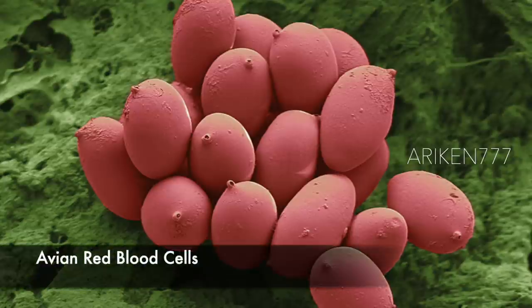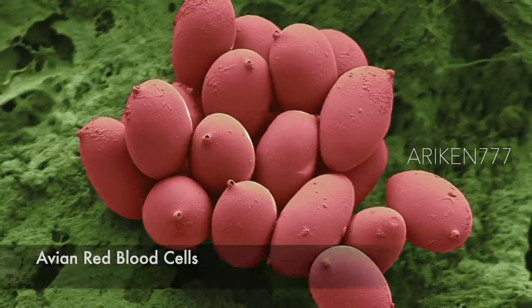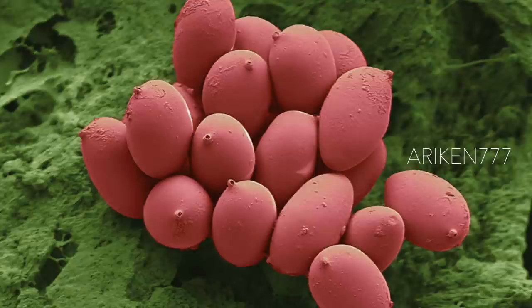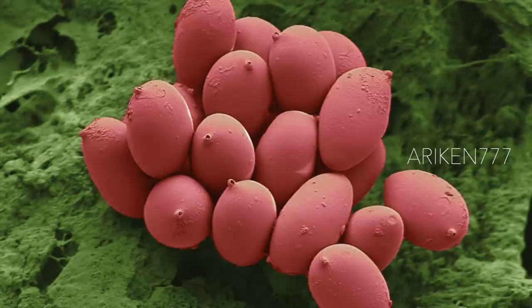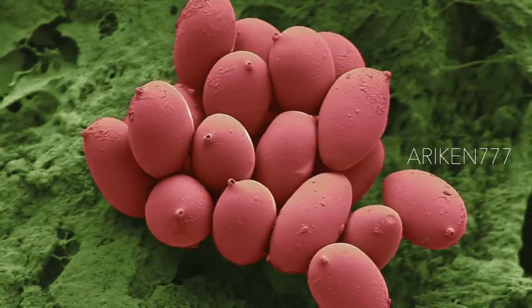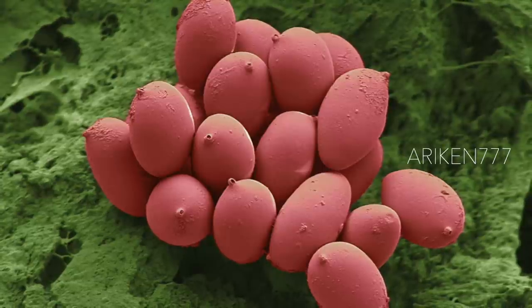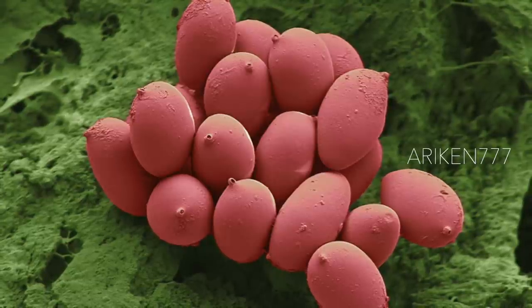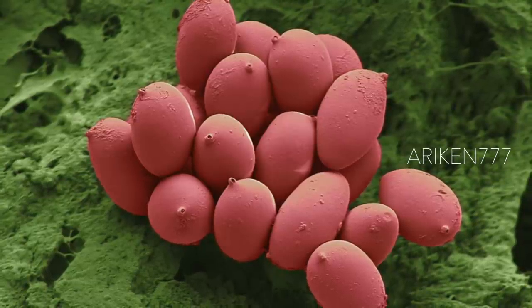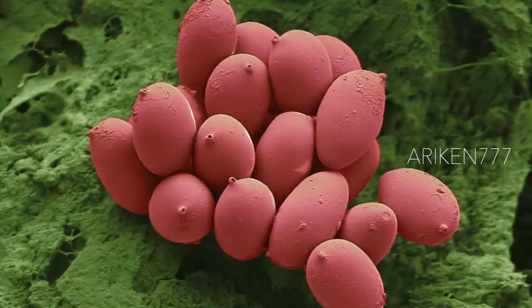Red blood cells contain hemoglobin, a pigment that allows them to carry oxygen around the body. Non-mammalian red blood cells such as these are oval in shape and contain a cell nucleus. Human red blood cells are disc-shaped and do not have a cell nucleus.